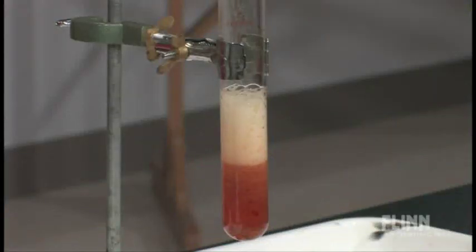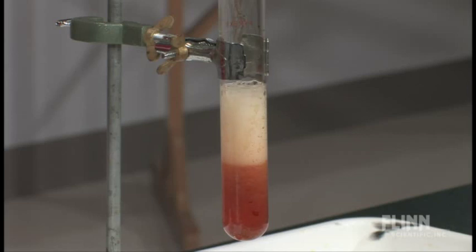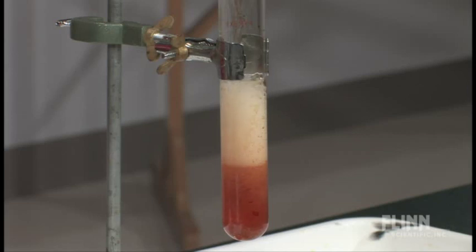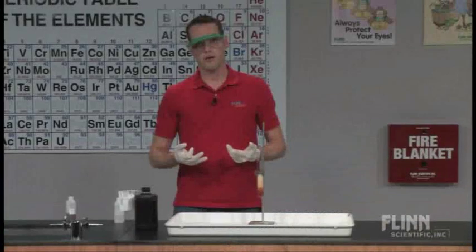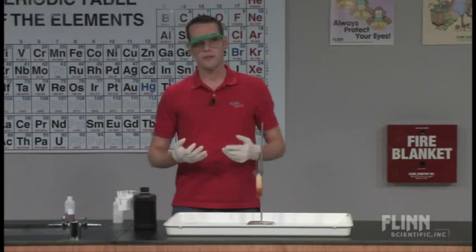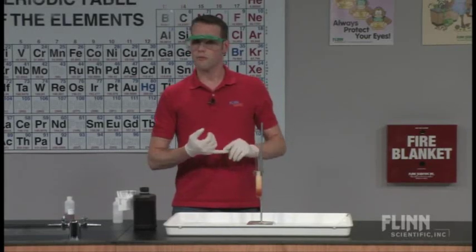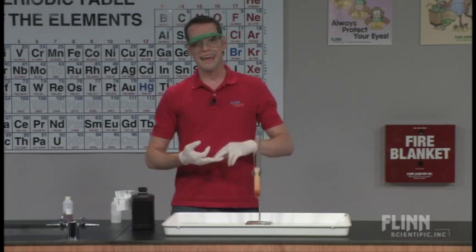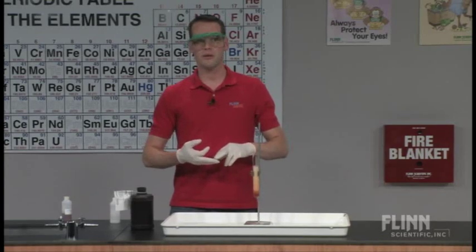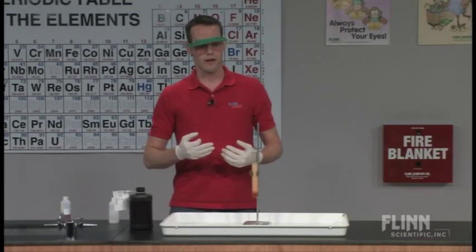Now we have a much slower, controlled reaction, so you can nicely show the demonstration of both catalysis and inhibition of a chemical reaction. It's a really nice one for showing reaction intermediates, for showing the role of a catalyst, and for showing how inhibitors can slow down the rate of a chemical reaction. Thank you.